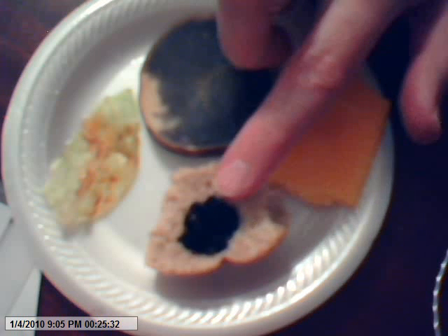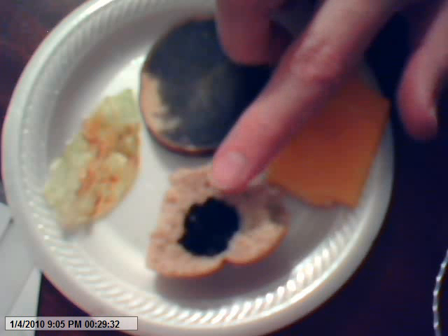So we started with our first control, which is this piece of bread. Now we all know that bread has starch in it, and when I place the iodine on top of it, we see that it turned a very dark blue color to show the presence of starch. So item number one for your write-up is bread, and you would draw a picture of this.